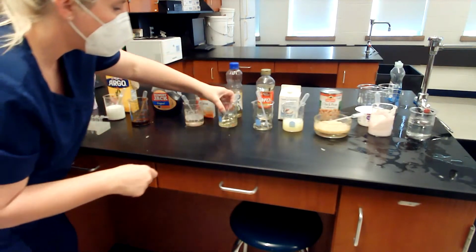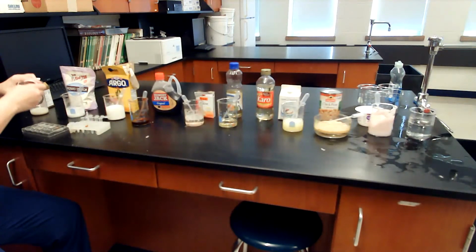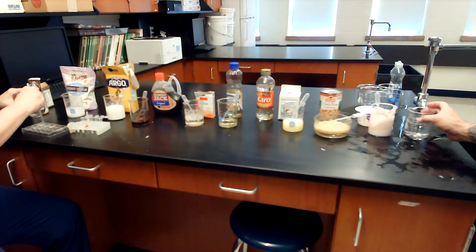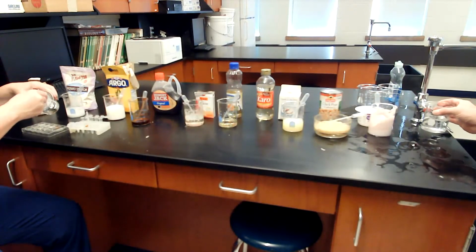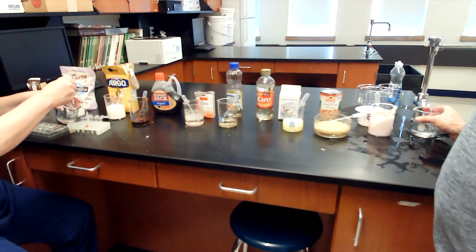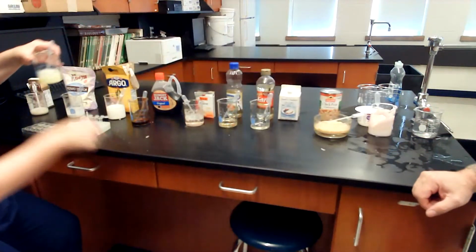Vegetable oil. This is corn syrup. Is it really thick? Yeah. You want to add a little water to it? I'm just trying to make a mess to have this drop in other tubes. Here. Do you remember? Just make a mental note of where I'm putting this. Okay. Your order. This way.